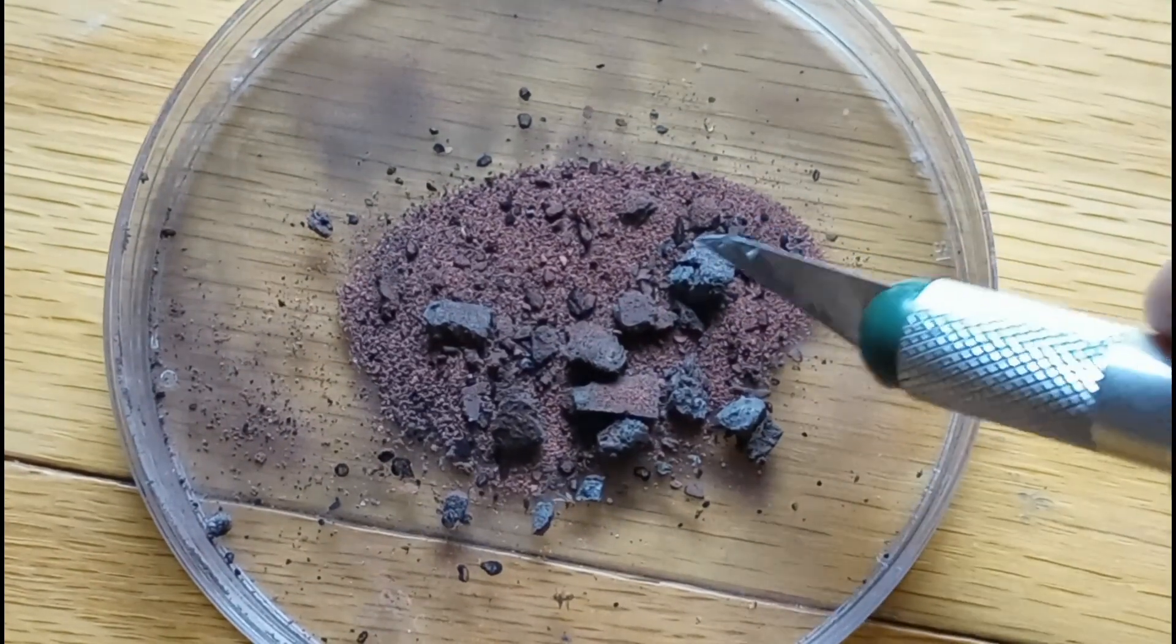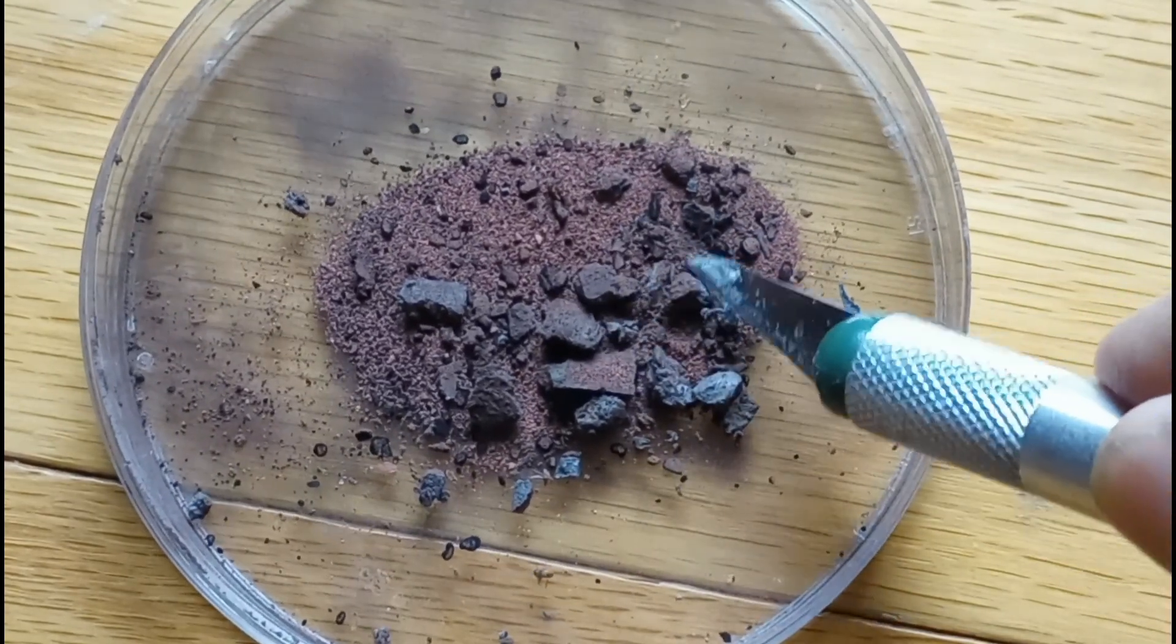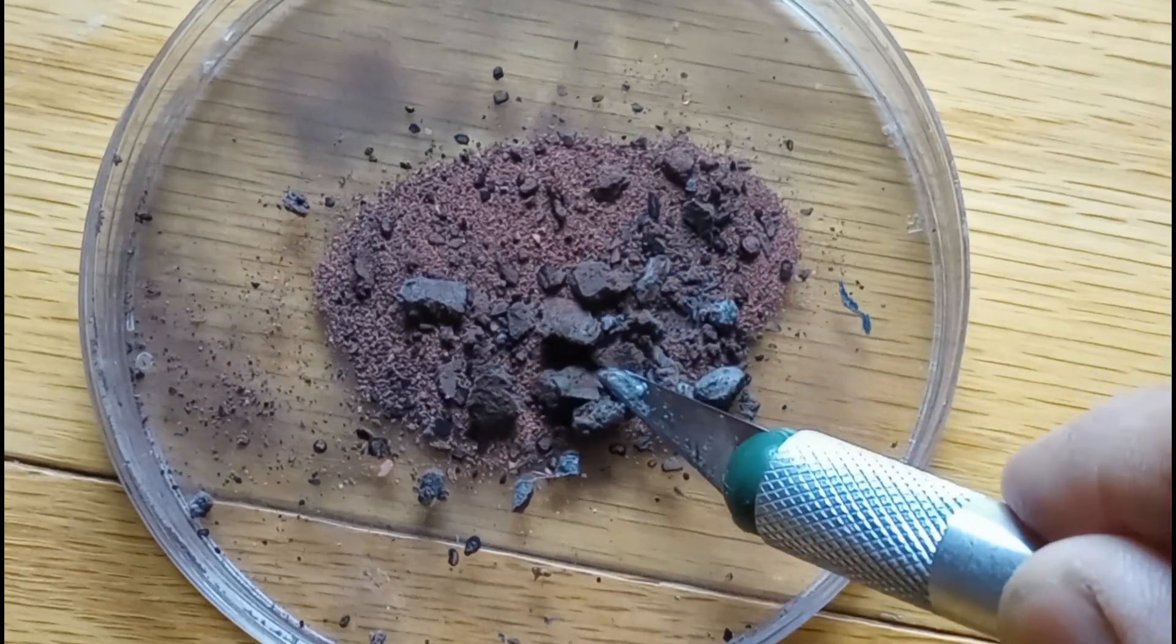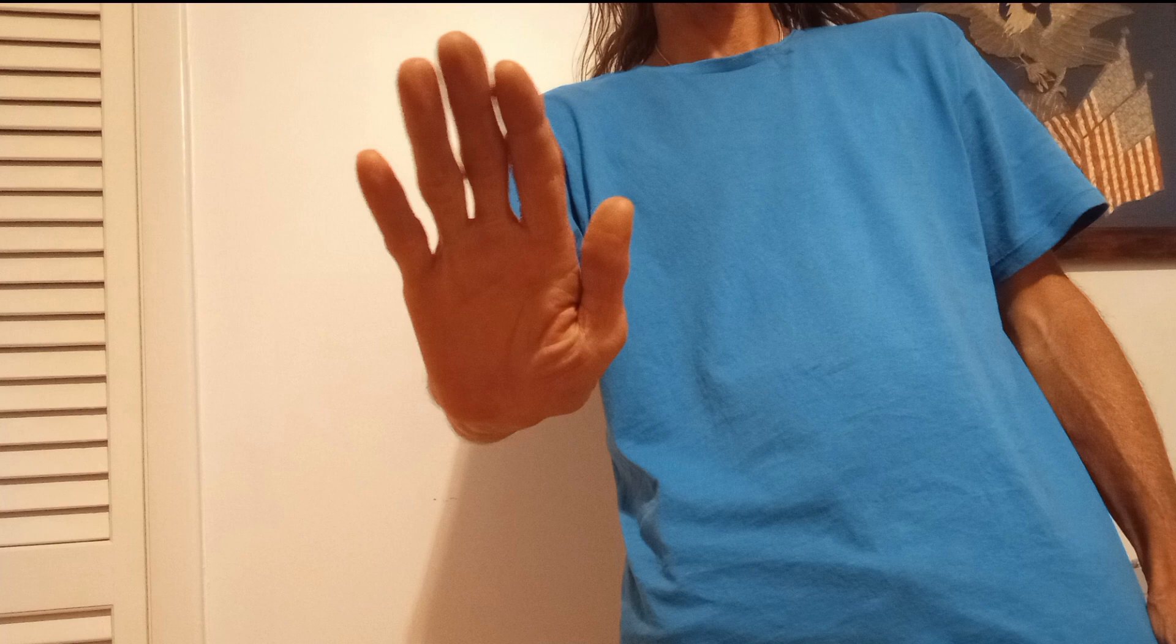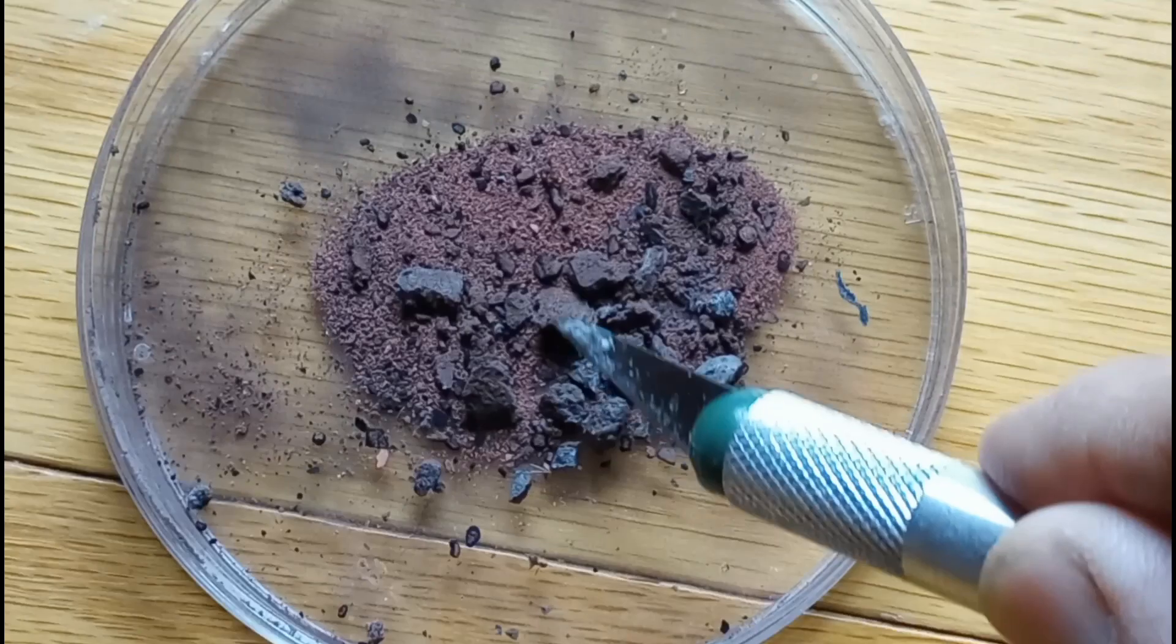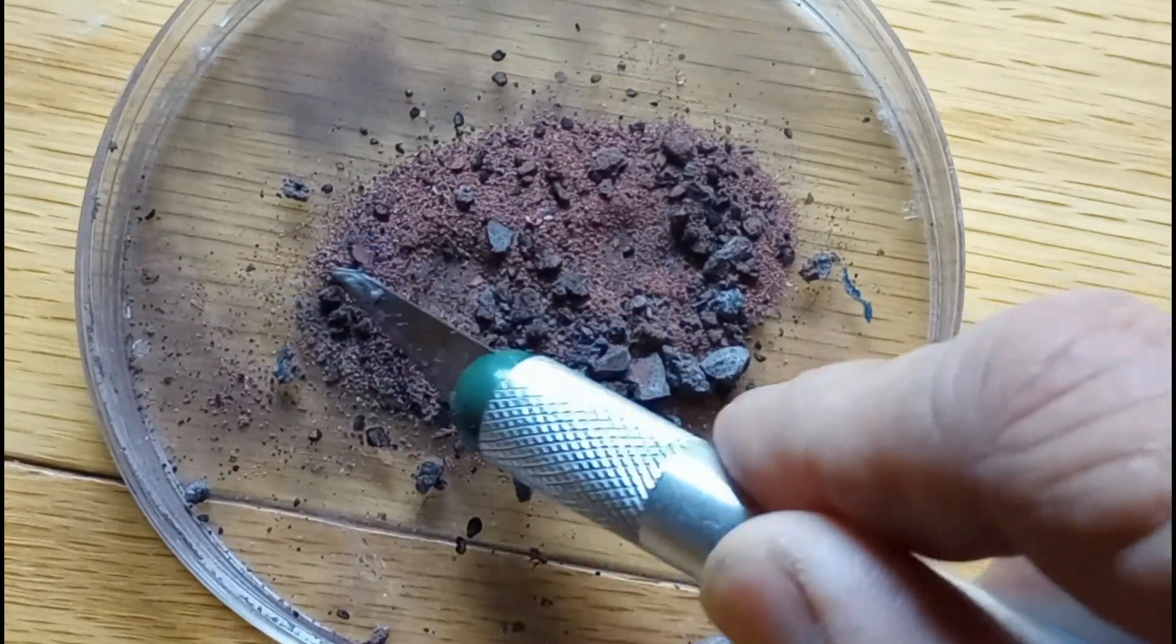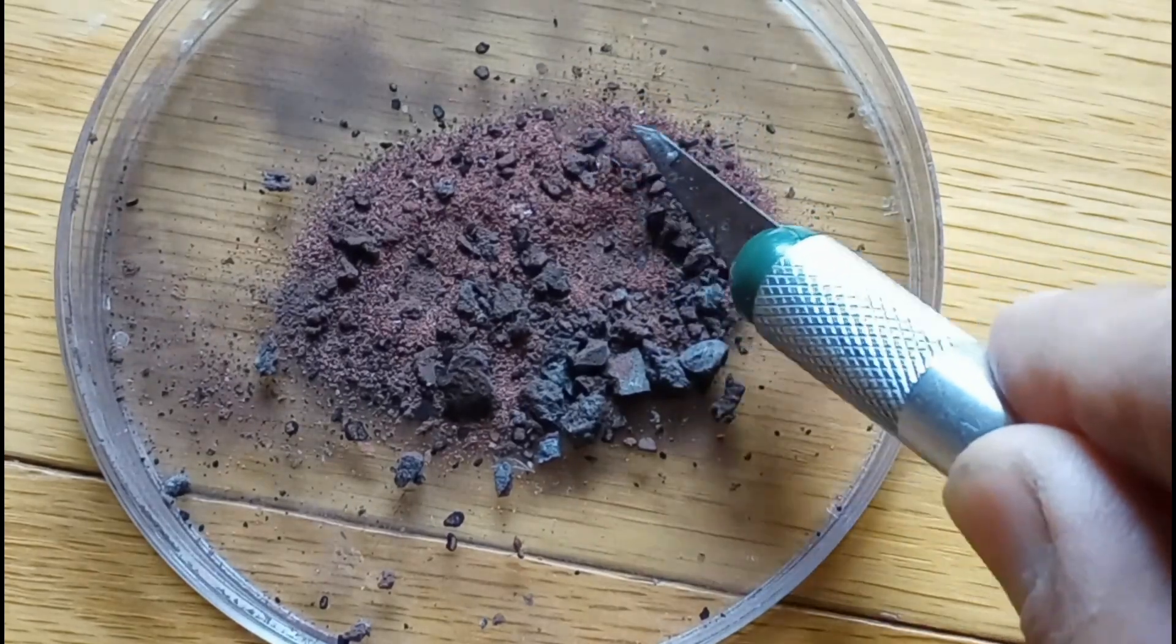This is all of the copper substance with black flakes left from episodes 4 and 5 of the brass, copper, zinc, and acid series. This material is part of the chicken series, but we decided to change the title.